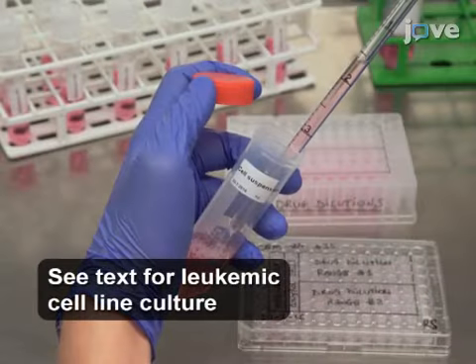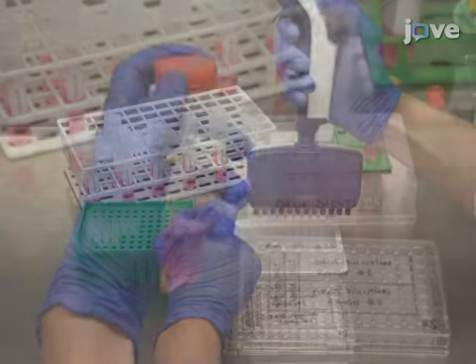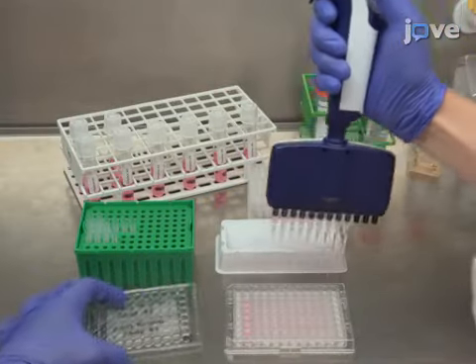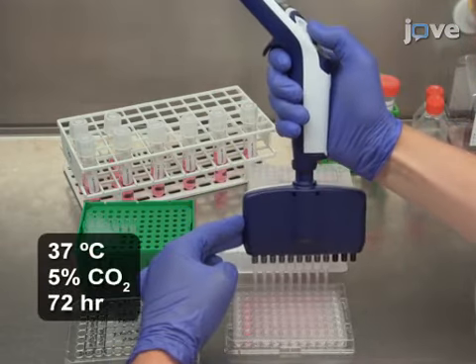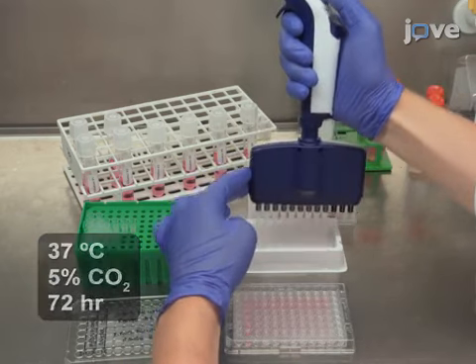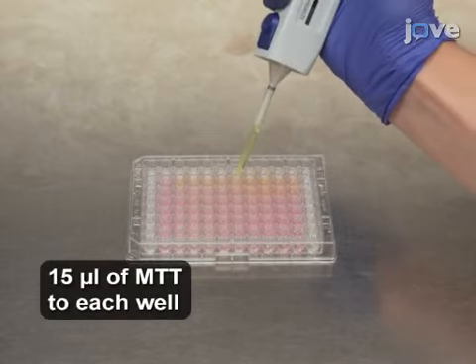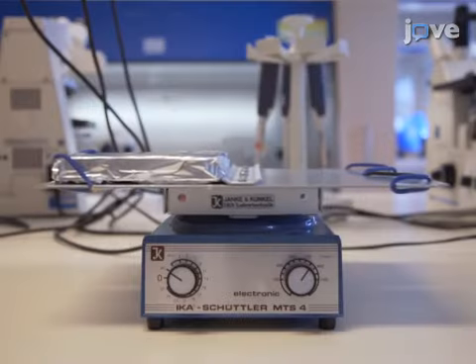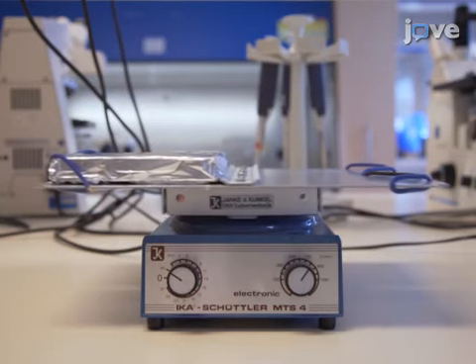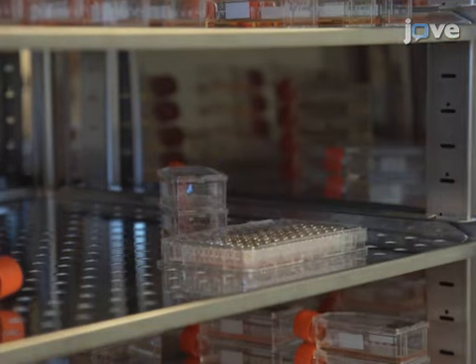Harvest exponentially growing leukemic cells and resuspend them at their optimal seeding concentration. Add 120 microliters of the cell suspension to each well containing either the drug solution or the growth medium, and incubate at 37 degrees Celsius with 5% carbon dioxide for 72 hours. After the incubation step, add 15 microliters of MTT reagent to each well by using a repetitive pipette. Shake the plate for 5 minutes with a plate shaker up to a maximum of 900 shakes per minute. Place the plates back at 37 degrees Celsius with 5% carbon dioxide in a cell culture incubator and incubate for another 4 to 6 hours.